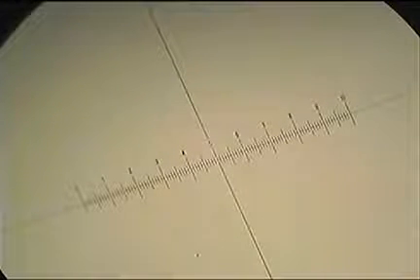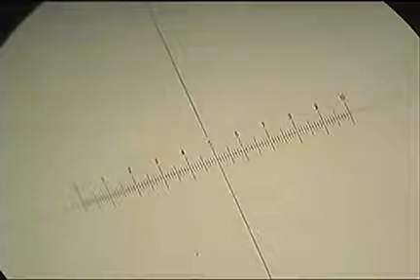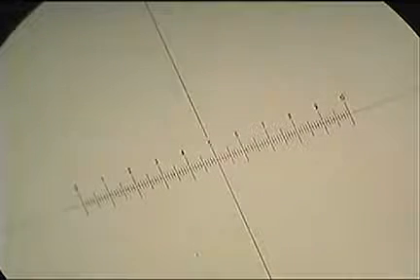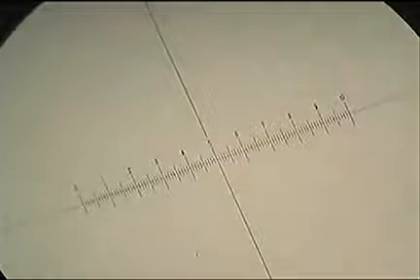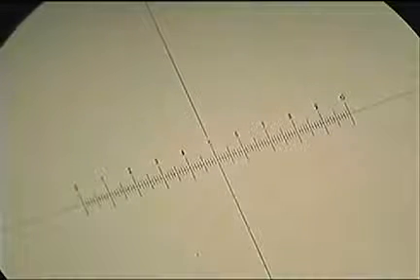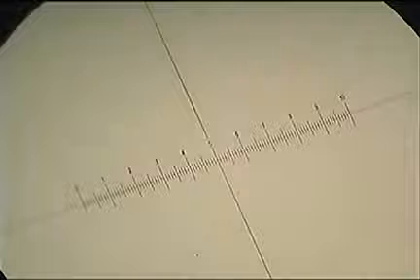Okay, so I'm just going to walk you through how to take measurements of cells or other microscopic structures using an eyepiece graticule and a stage micrometer. Under the microscope, whenever you're looking at things, you'll notice you've got the scale. This is actually something that's in the eyepiece. It's called the eyepiece graticule.